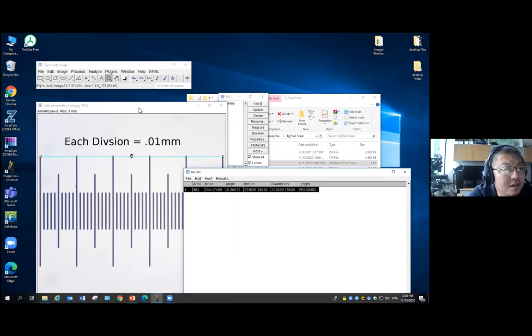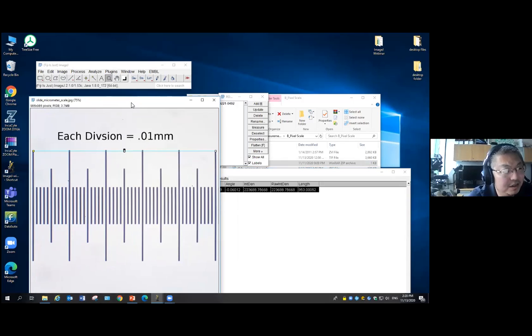But now we know, since we spent all this money, we need to get some more information. We buy this slide. We know what the physical length is: 1, 2, 3, 4, 5. Actually, each smallest division is 0.01 millimeter. So this is actually a total of 0.5 millimeter. One of the smallest divisions is 10 micron, and we have 50 of them, so we have 500 micron.